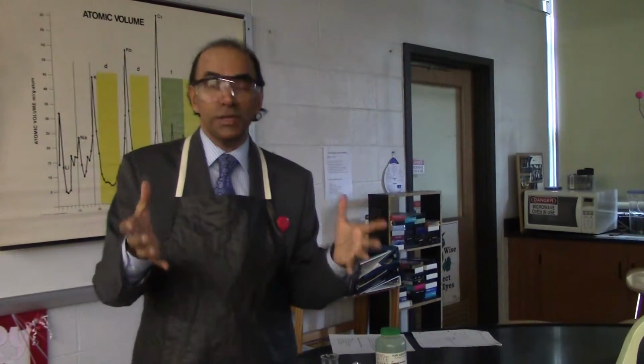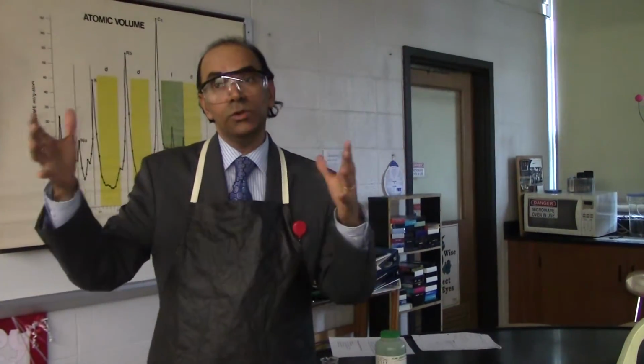So today's experiment has to do with synthesis of copper. How do you make copper? Okay, so we're in an area of science called metallurgy, and this is a great topic to have a discussion on in class with your students.